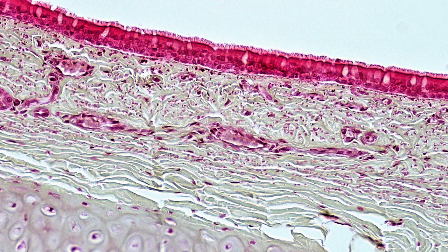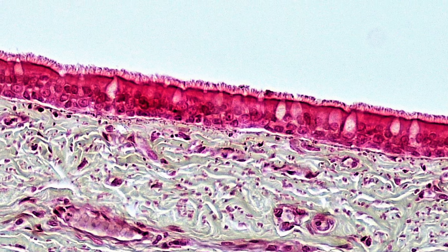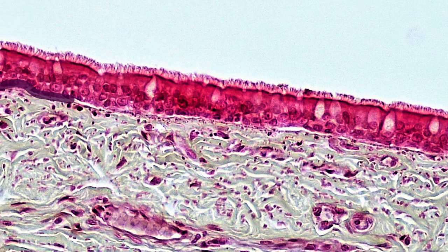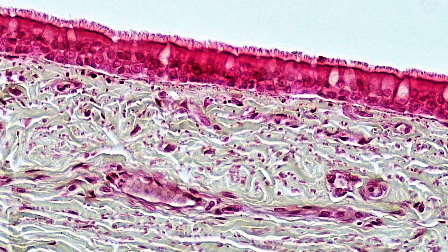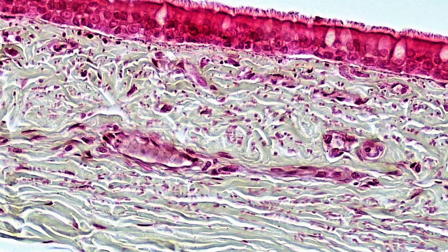Let's see what that looks like on a real slide. This is a slide of tissue from the respiratory system. We can see our epithelial cells on top — those bright pink cells with the cilia sticking out of their apical side. Underneath that is their basement membrane, it's really thin, and then underneath that is the lamina propria. We see all those blood vessels, some connective tissue, and it's much thicker than the epithelium on top of it.